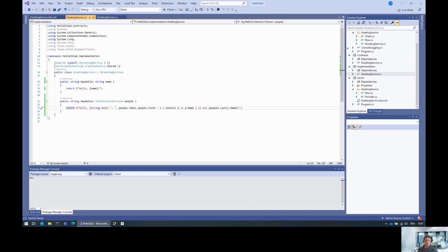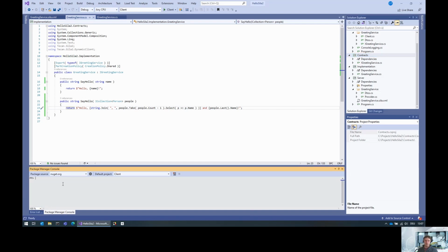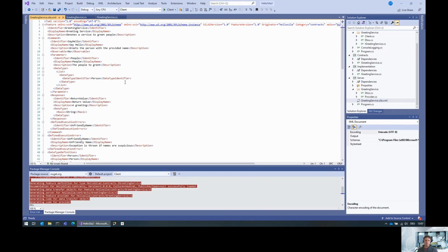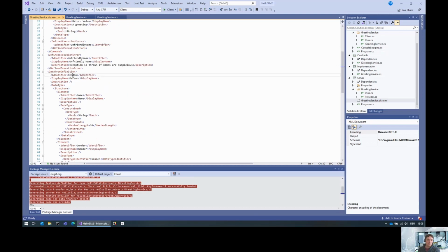Next, again, we have to compile the contracts. Very important. And that's done. Then we regenerate the code. Once we do that, we can open up the feature that's been generated for us. And you see here that the parameter is now called people, and the type of that is a list of person. And the person is down here.